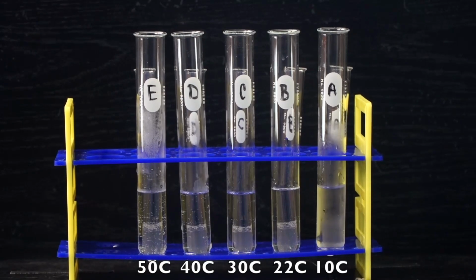Right, so we have our large and small test tubes taken out of the water bath, and now in quick succession, add the contents of the small test tube, which is just the potato catalase, into its respective large test tube that it's next to. And you'll want to do this in quick succession so that we have as similar of a start time as possible between all 5 test tubes.